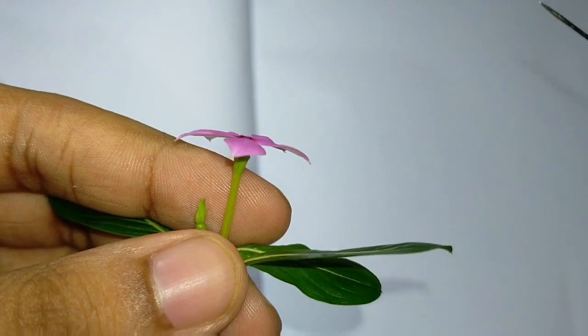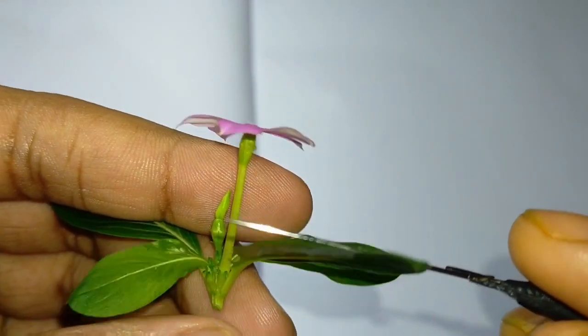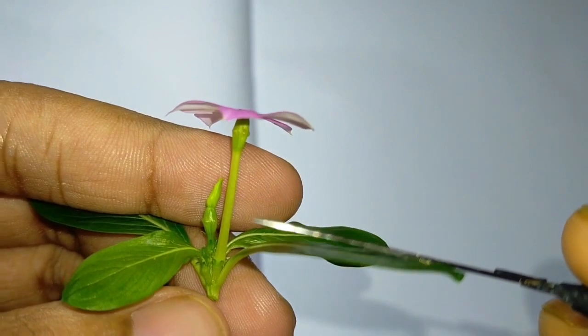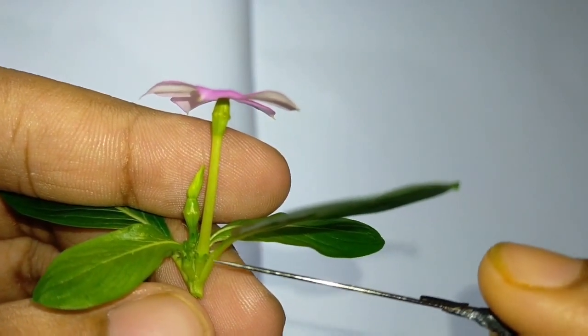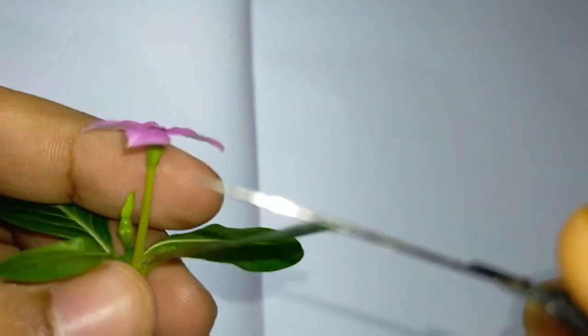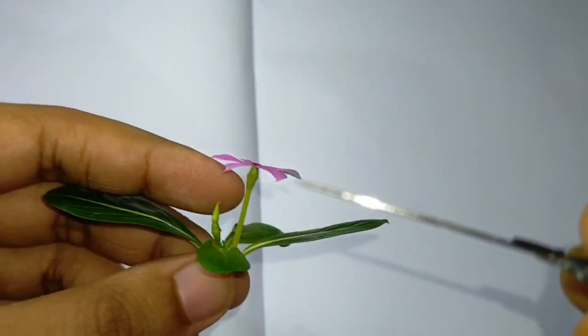Before starting the androecium part, let us do the dissection of this flower. When you start the dissection, you should move from the bottom to the top. So let's start the dissection.